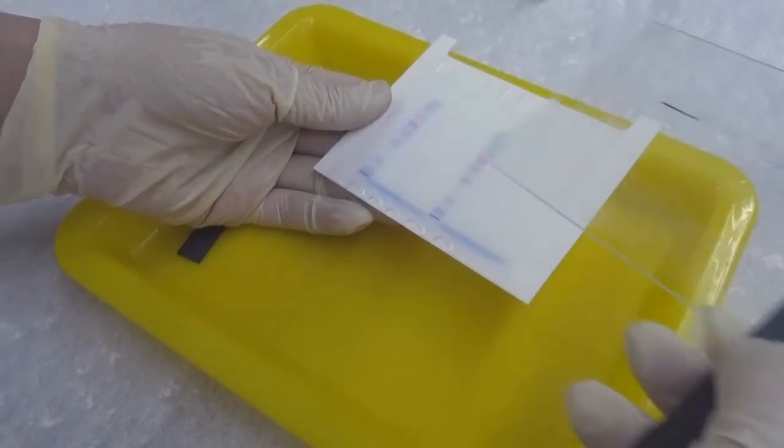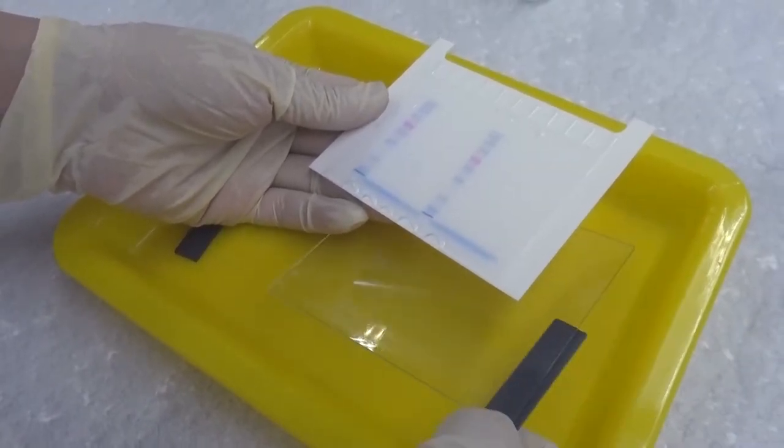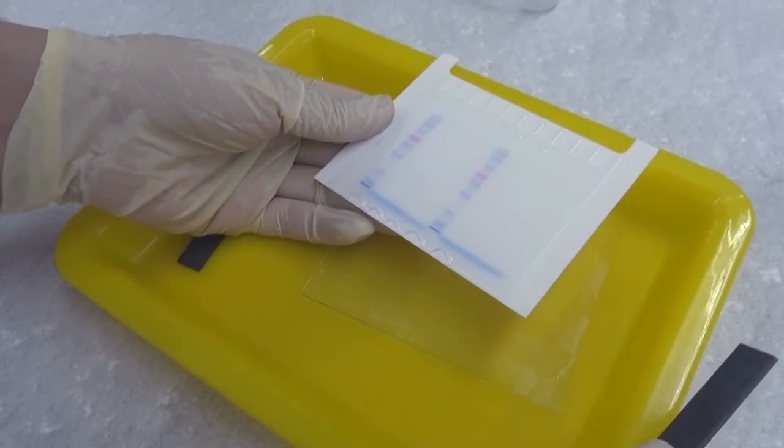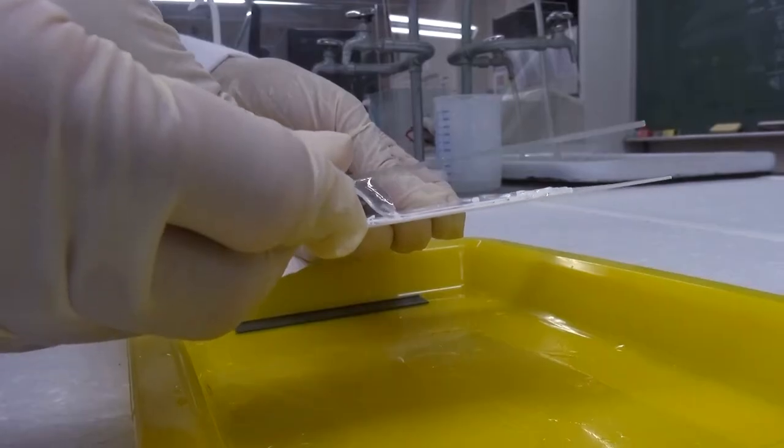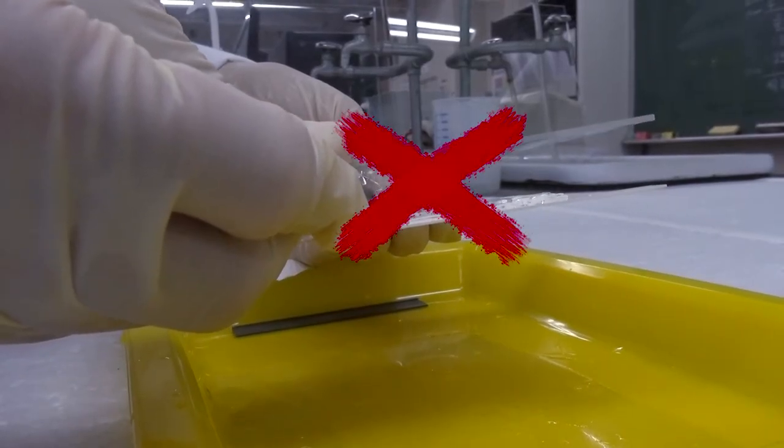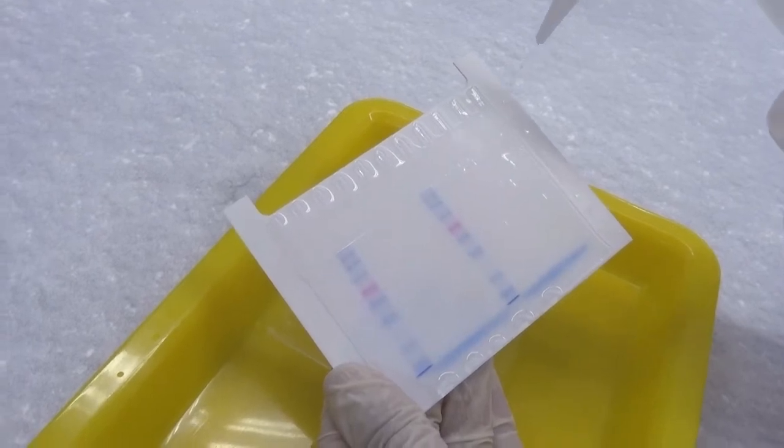If you encounter difficulty, adding a few drops of distilled water or electrophoresis buffer may help. Be careful not to tear the gel. The gel usually stays with the aluminum plate.